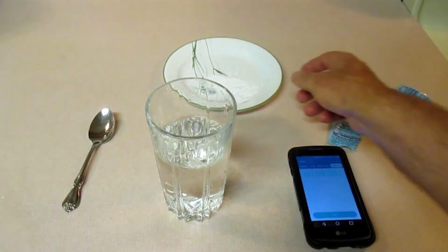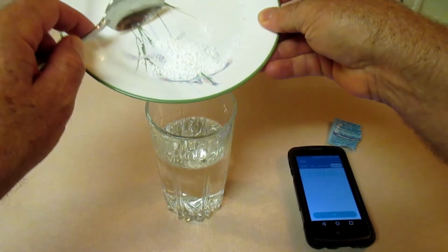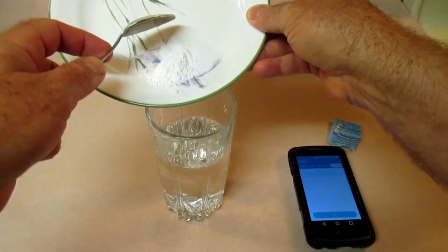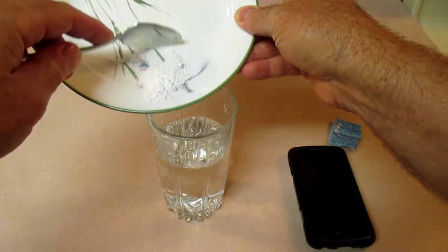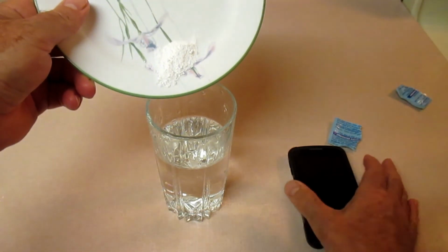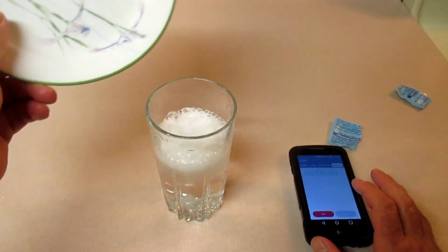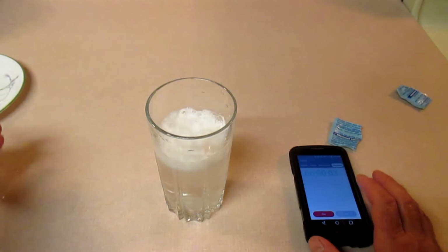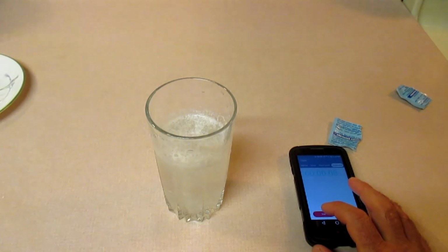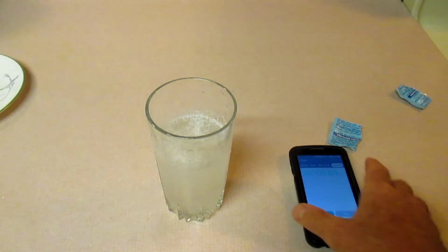Alright, I'm going to record that temperature in the data table provided. And what I'm going to do now is get ready to put this into my cup of water. Alright, so I'm going to get it kind of lined up. Sort of wish I had another hand, but that's life. Alright, now when I dump it in there, I'm going to hit start. So as you can tell, the reaction goes a whole lot faster, and I'm going to stop it, because the smaller particles have a greater amount of surface area such that the reaction occurs faster.